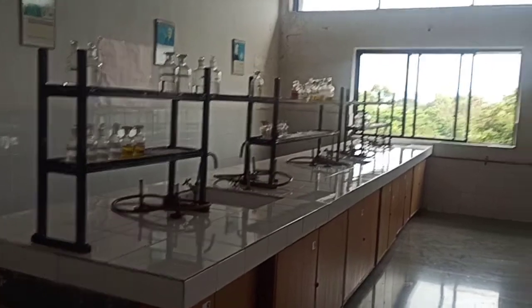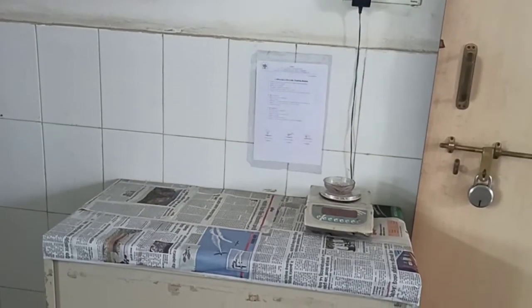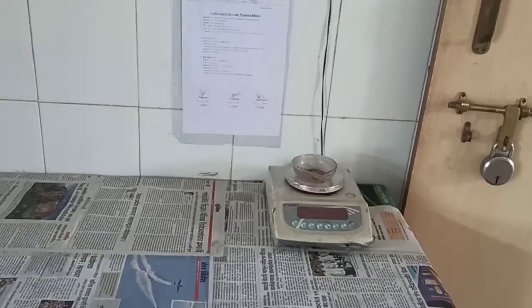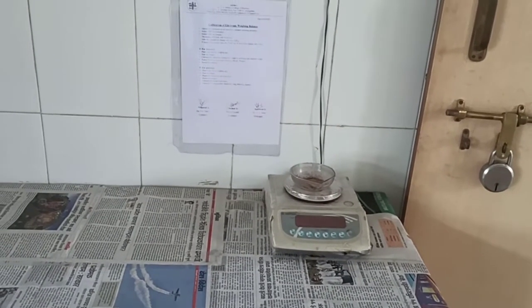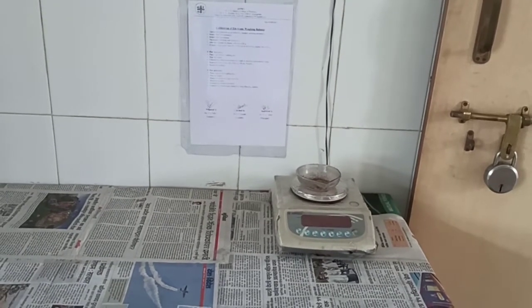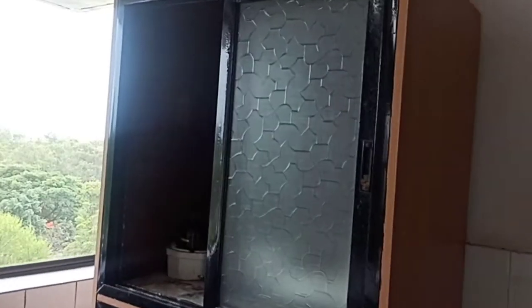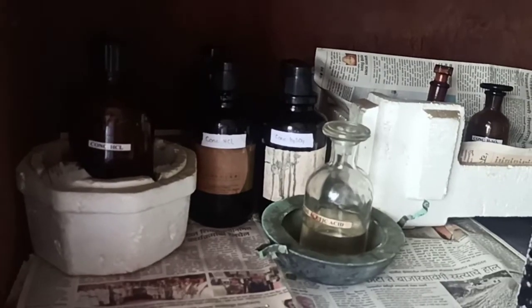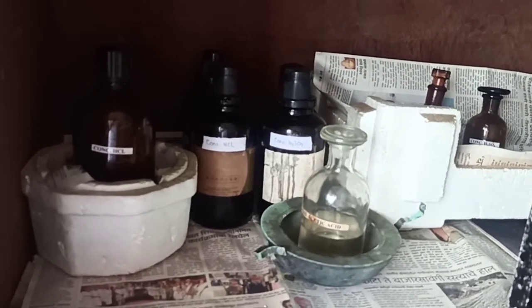These are the platforms. This is the weighing area. Here, for accurate weighing of chemicals, you have to read the SOP and then according to that procedure, you have to weigh your chemicals. This is the fuming cupboard. Corrosive chemicals are kept here, like sulfuric acid, hydrochloric acid, and concentrated nitric acid.